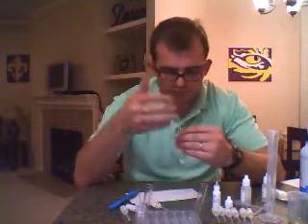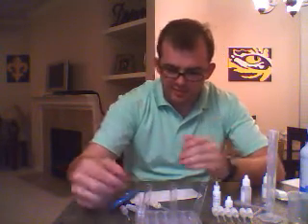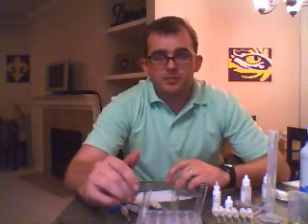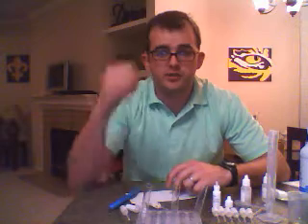Let's see if it has any odor. Not really any that I can tell of any significance. Alright, so I wrote down my observations there. And once I'm off the video, I'm going to write a net ionic equation for it.